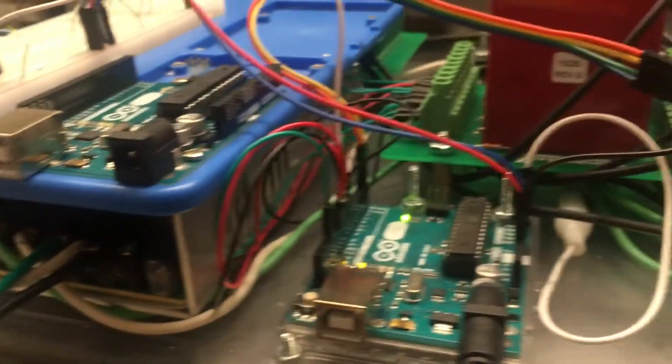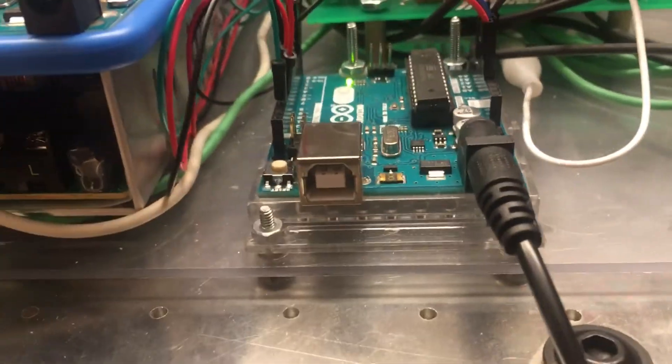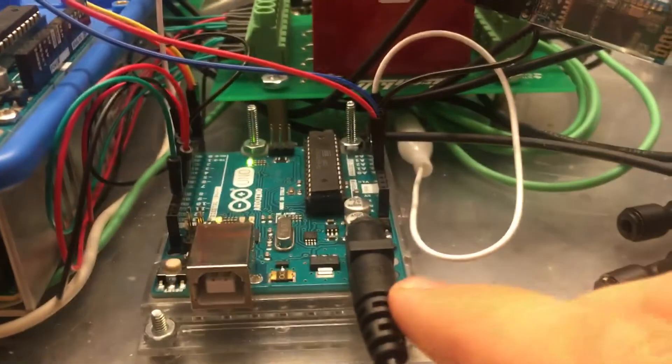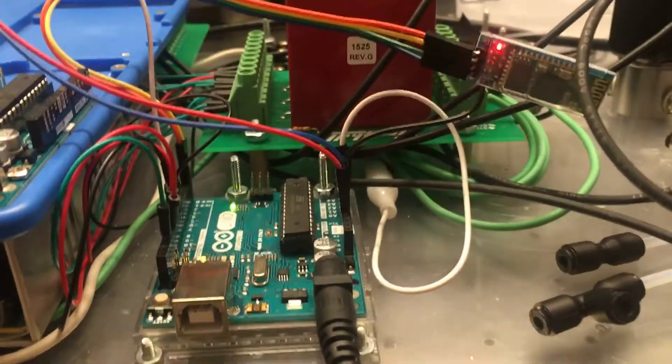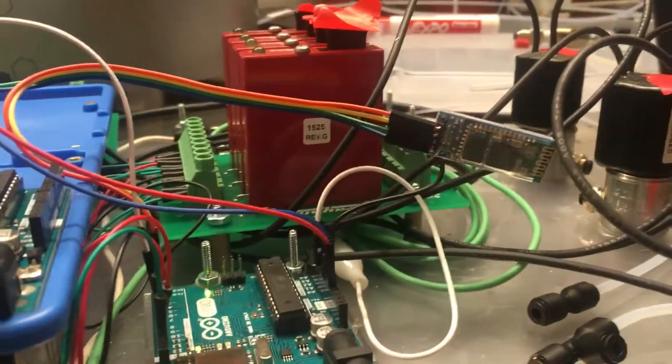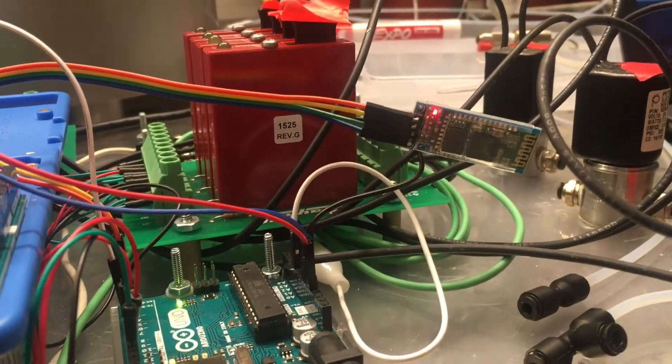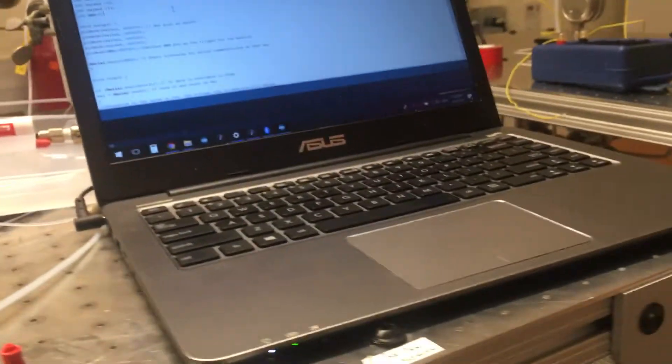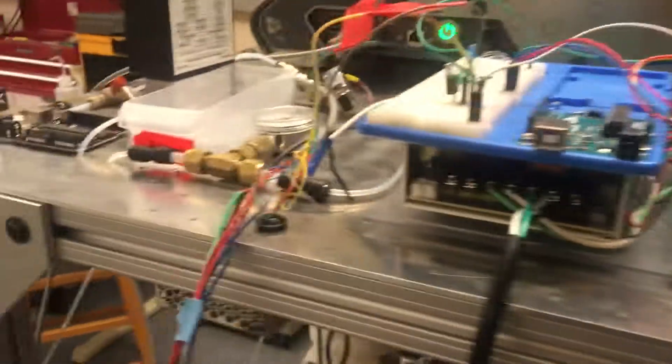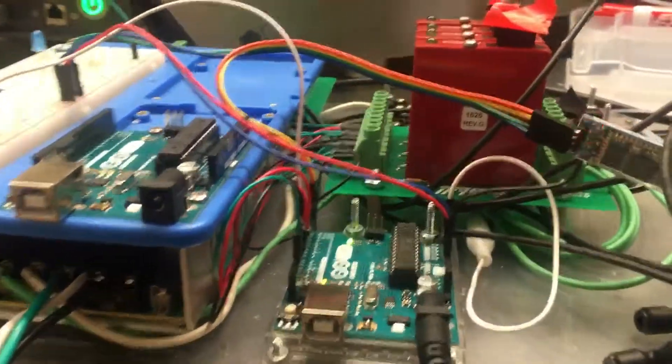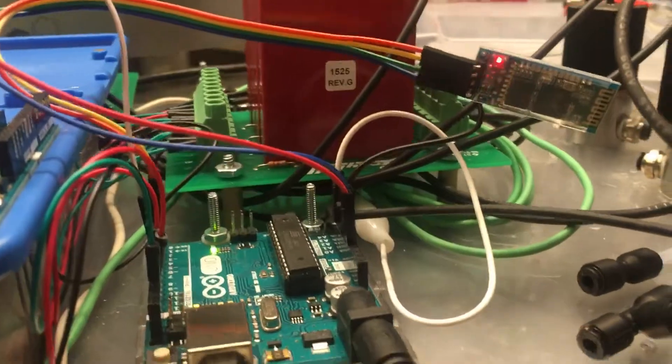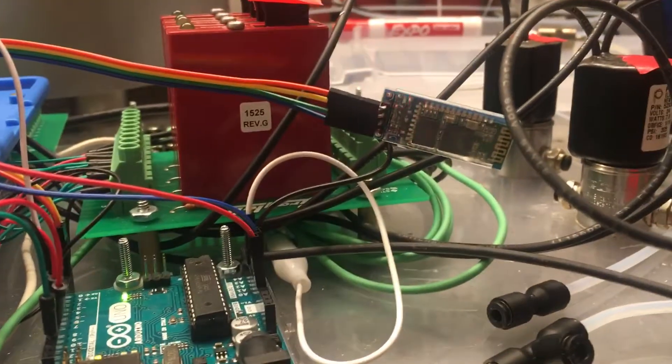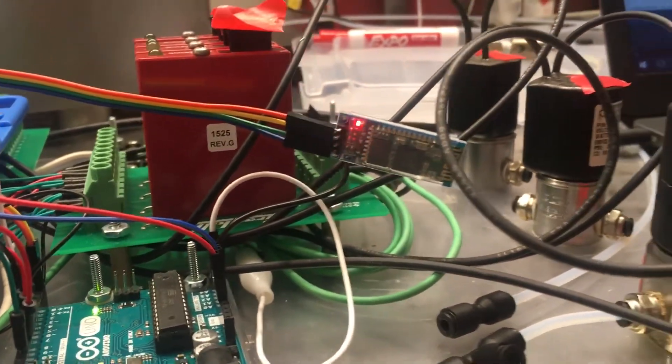And so on this Arduino here, you'll note how there's only a power cable connecting this. The reason for that is we're able to now send and receive data over this very nice Bluetooth module, so we have a wireless connection between the laptop here, which can be anywhere within range, and it can operate and control everything on this part, which is very nice. What you'll note is right now it's in a mode when the Bluetooth device is ready to be connected to.